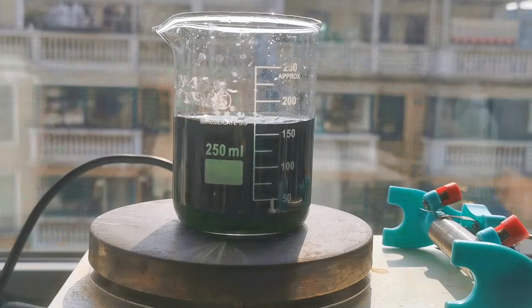You can see that it is very shiny because I wiped the surface with some hydrochloric acid to remove the surface oxide layer. The copper sheet is positioned in the electroplating cell and hooked to an alligator clip connected to the cathode of the power supply.